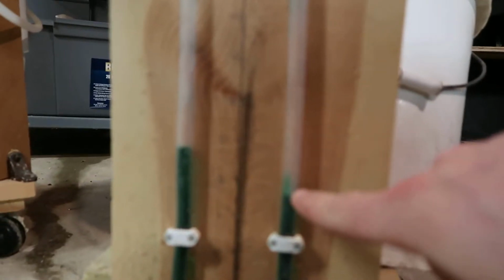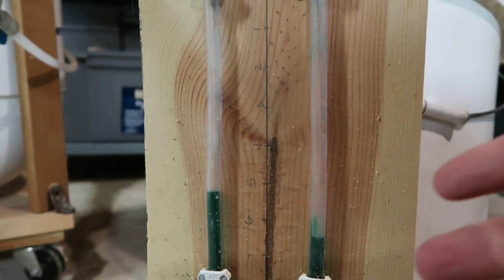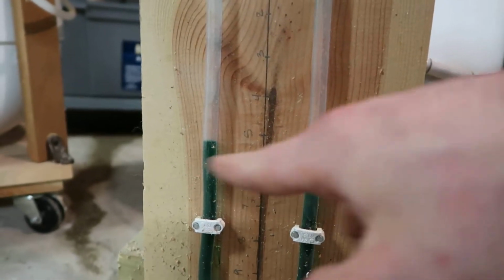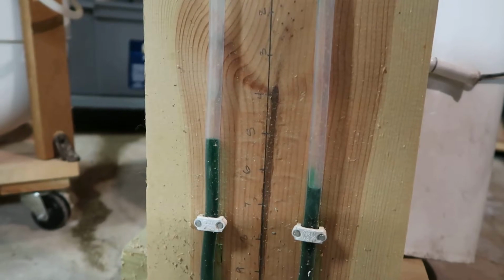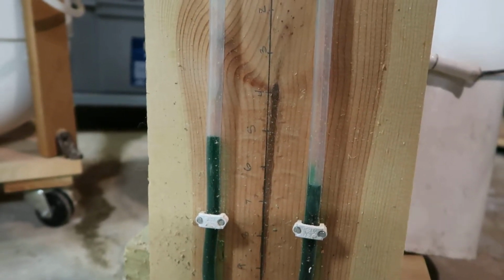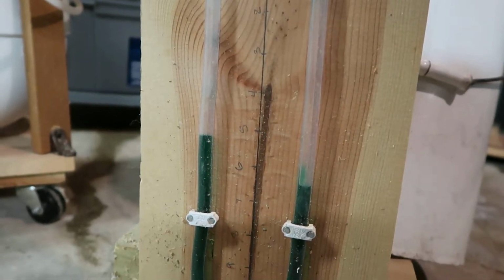And over here, this is the differential pressure indicator. So you can see these are not at the same level. That shows that you don't have a column plug, because if your column gets plugged, these are going to even out. It's showing that you've got flow through your system. Those are both critical elements for troubleshooting, and also it helps with reproducibility to make sure that your column isn't getting plugged.